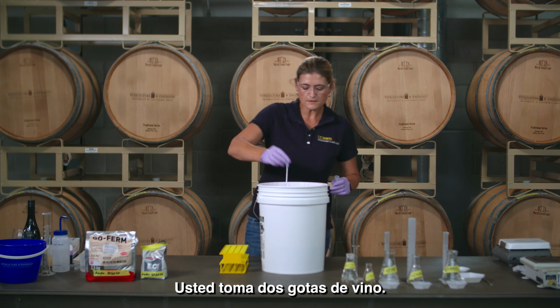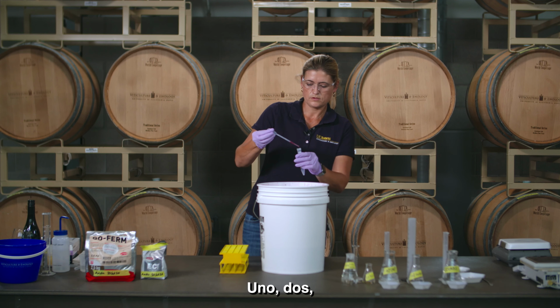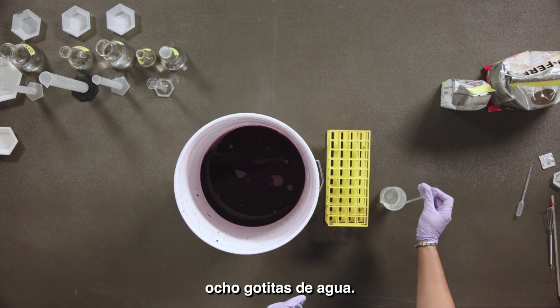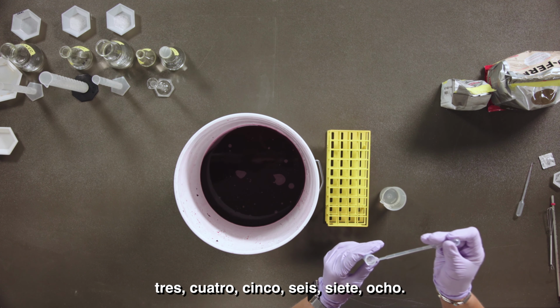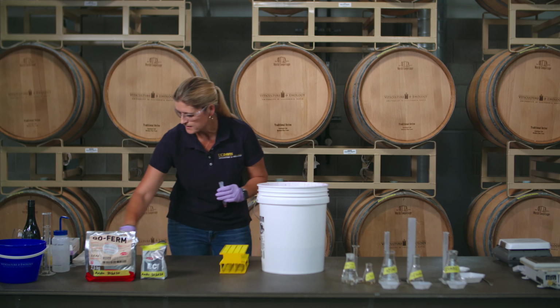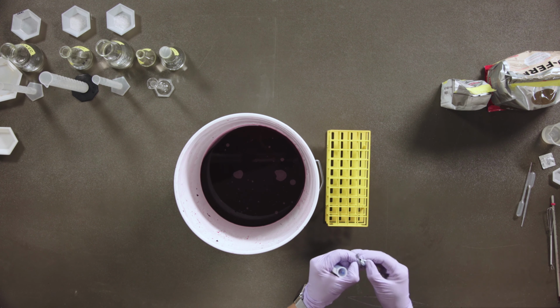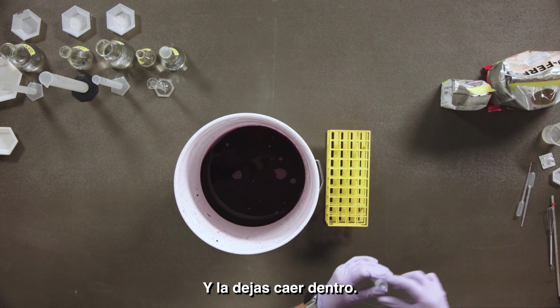you take 2 droplets of wine, 1, 2, and you take 8 droplets of water, 1, 2, 3, 4, 5, 6, 7, 8, approximately, and you add the Clinitest tablet. I've already opened the package here. It can be a little bit tricky. Whoops! And you drop it in.